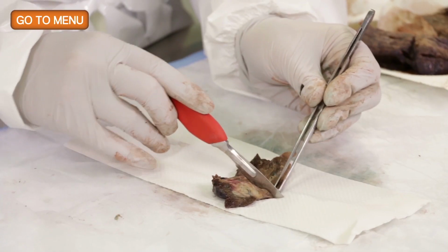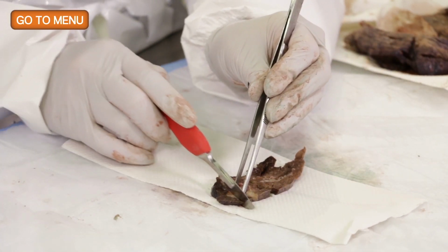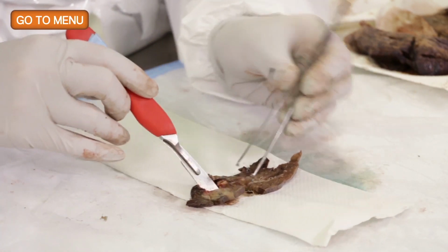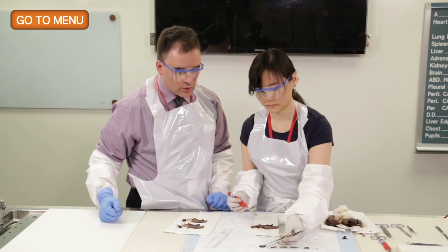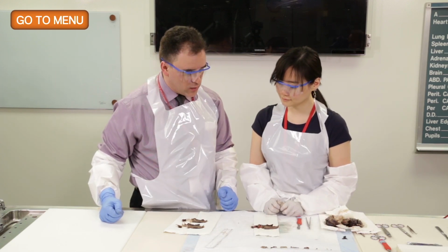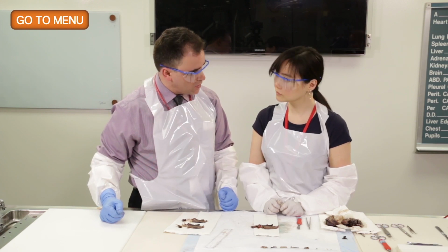Part of the reason we like to see the interface between the tumor and the normal is that there are certain patterns of adenocarcinoma that are different in different parts of the tumor. And so we're trying to get areas that would sample the tumor completely so that we can see all the different patterns of adenocarcinoma, especially if there would be a pattern histologically that would predict either a more favorable or a poorer prognosis. And so we need to classify the adenocarcinoma in addition to measure it. And so that's the purpose of taking several sections.